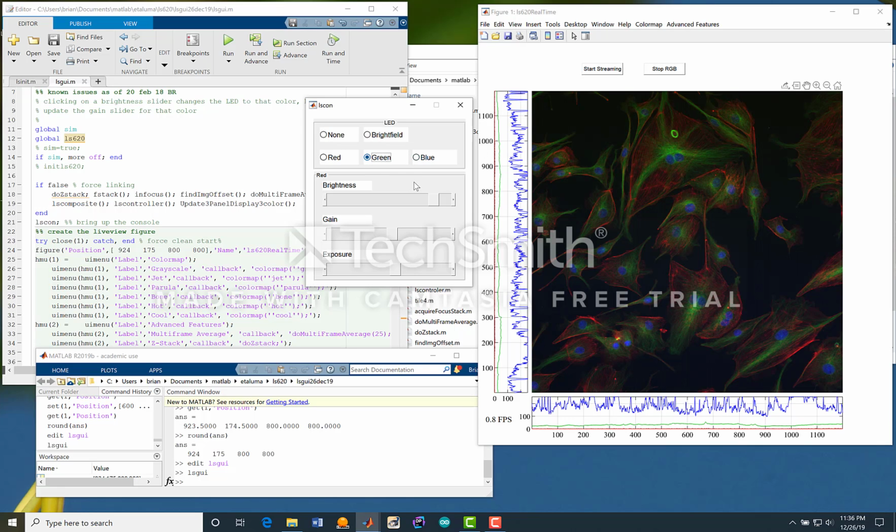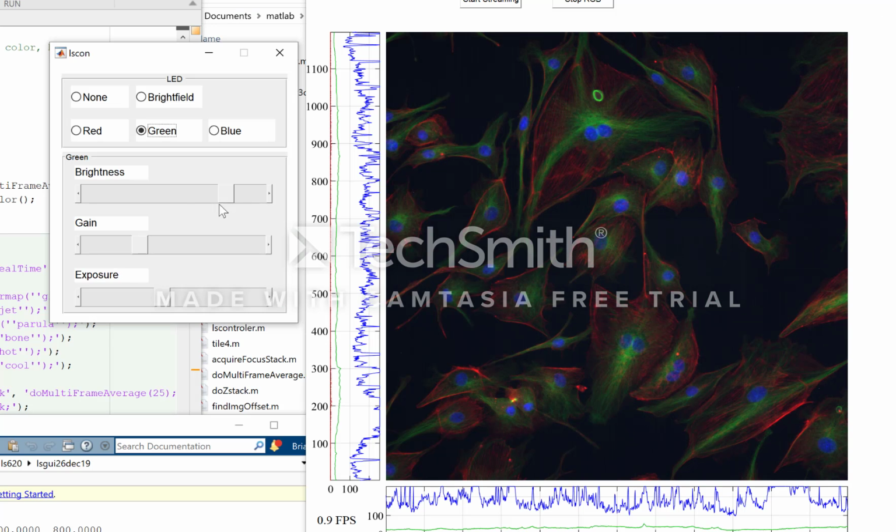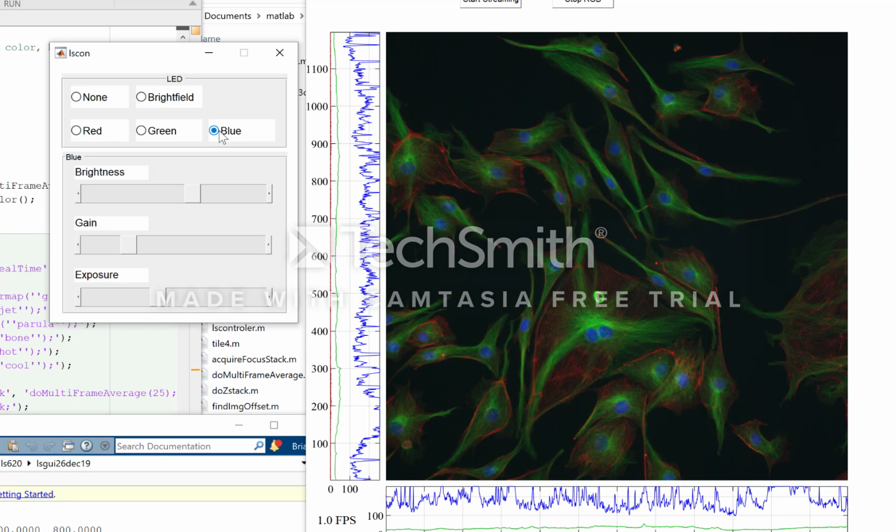Now, it might be nice to add a little more green to that. Could take up the brightness or the gain. Blue seems a little bit hot to me, so we can pull it down. And we can do some panning as well.